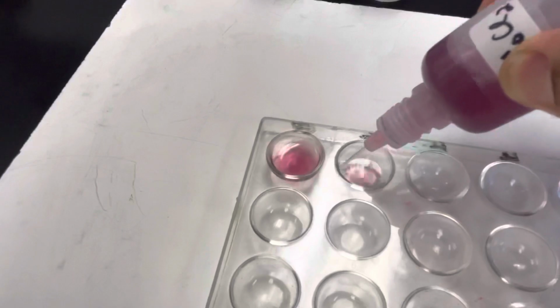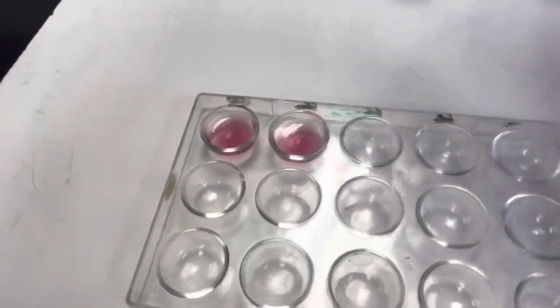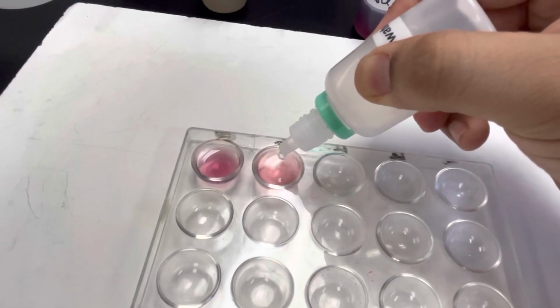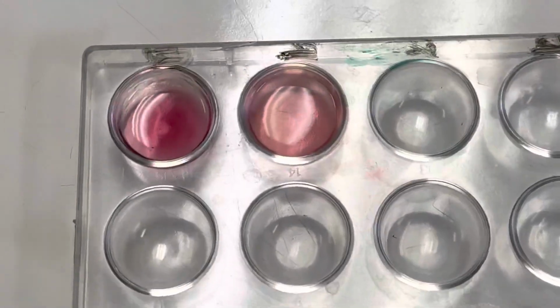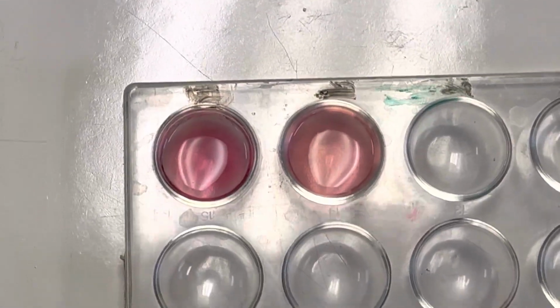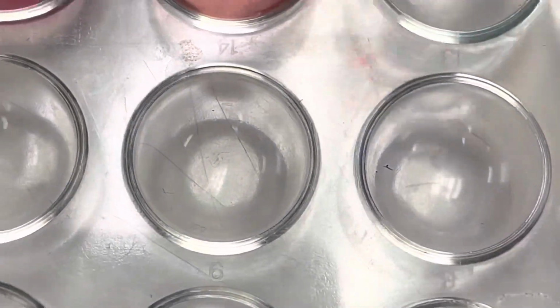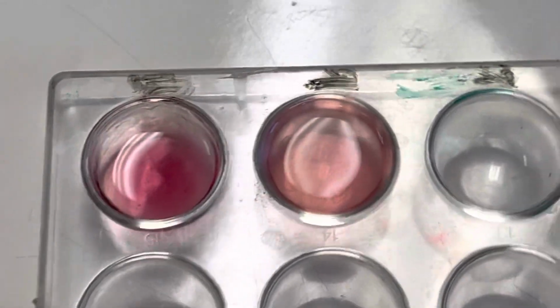I'm gonna add another one here. And then I'm gonna do one of our stresses to it. So the first stress I'm gonna do is adding distilled water. So here I go. I'm gonna add 1, 2, 3, 4, 5, 6, 7, 8, 9, 10, 11, 12, 13, 14, 15. And hopefully that is coming across on camera. The one on the right here is the one that I just added water to, and we should be able to tell, again, it's really obvious in person, that it is now like a pale pink rather than that magenta color. Maybe if I add more water, it can get pinker. See, now you can tell, it's definitely more of a pale pink there. So when I added water, that's what happens.